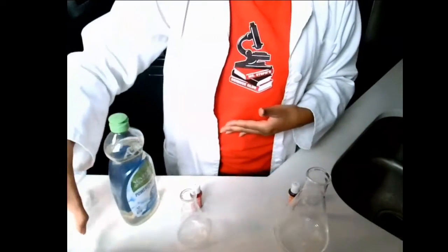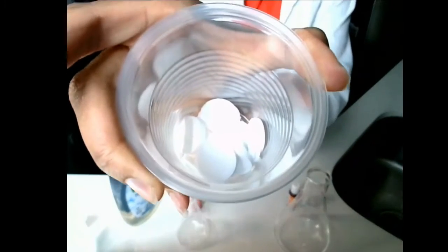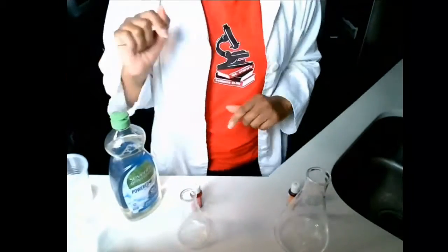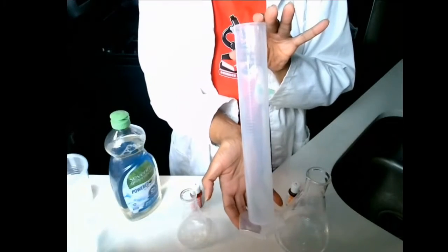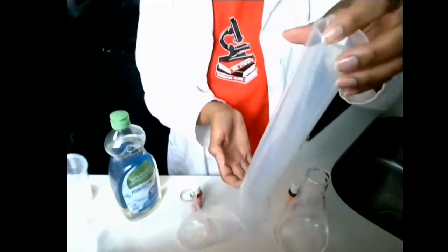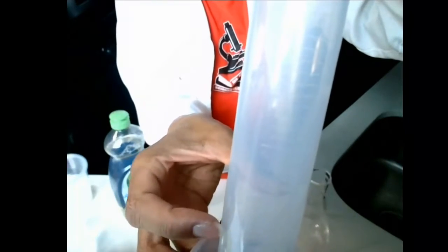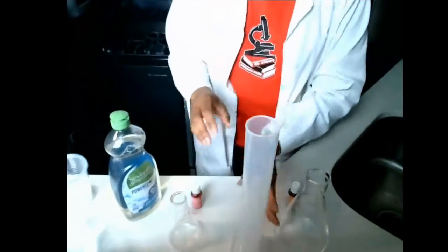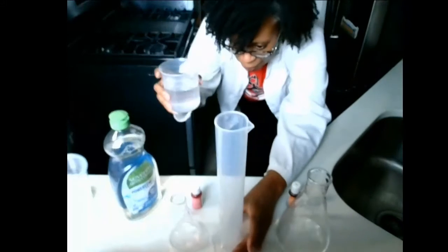I have water in this container. And I have my Alka-Seltzer tablets already opened up and out of the little envelopes. First thing I want to add is the water. I'm going to use my 250 milliliter graduated cylinder for today. The lowest that this cylinder measures is 25 milliliters and the highest is 250. So I'm actually going to be on the two ends of the spectrum when it comes to using this particular apparatus.